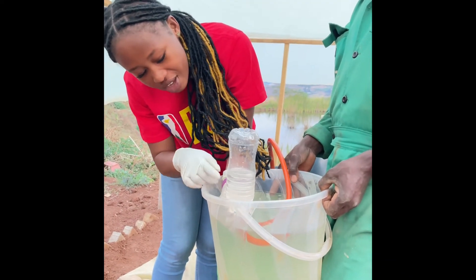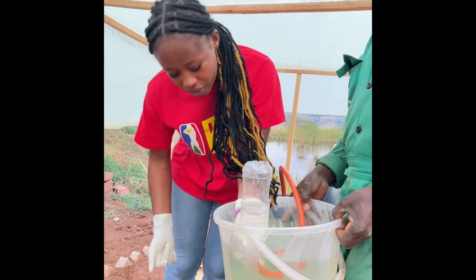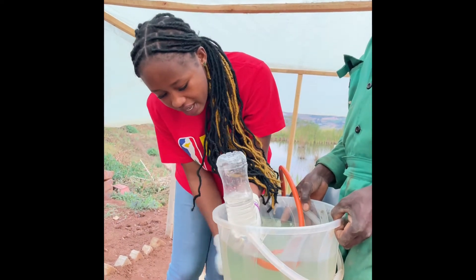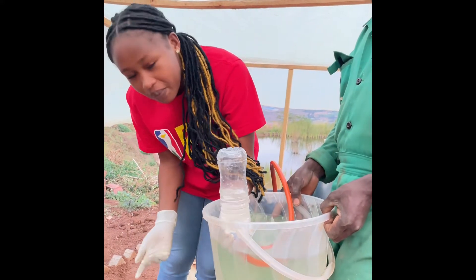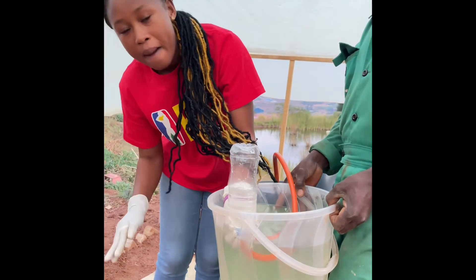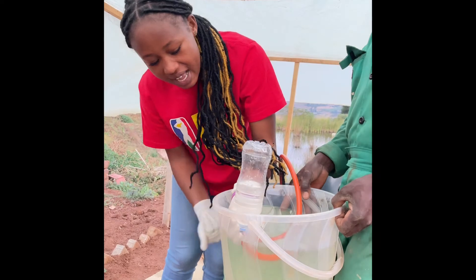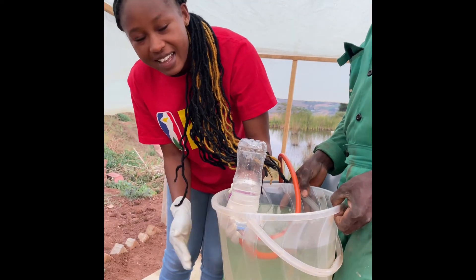So that means there's gas in it, but before we let the gas come out we have to apply pressure to the container to let the gas come out. We need a way to find the gas to come out effortlessly, but so far it's proving that there's gas in there. Gas can be produced from cow dung, and yeah, thank you.